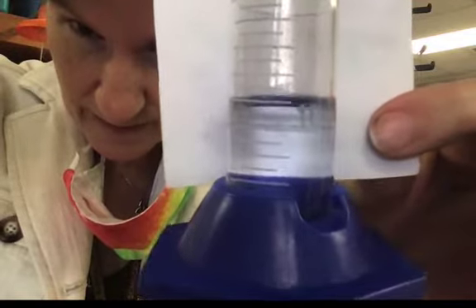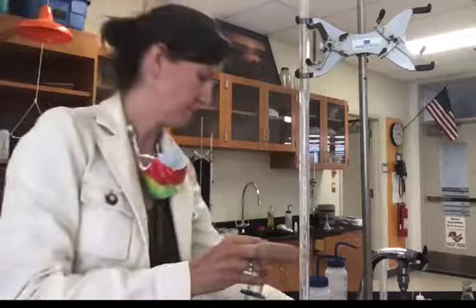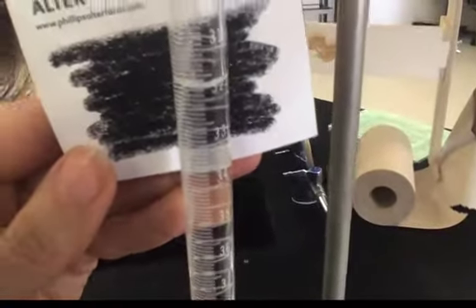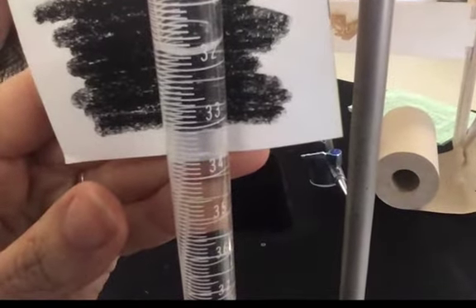Volume of acid for your third trial. Burette reading for the third trial. This will be your initial for your fourth trial.